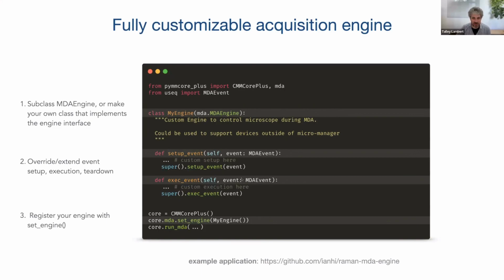So this really is your portal here. If you're familiar with Micromanager's hooks, I guess this would be the equivalent here. We don't really need hooks because we're not serializing and doing a lot of cross-process communication. You have much more direct control here over the core itself. So by just subclassing and overriding various methods as you need, you can completely customize exactly what is happening. So you could be using Micromanager for some events, and other events don't need to use Micromanager at all. You can pick and choose what you want.